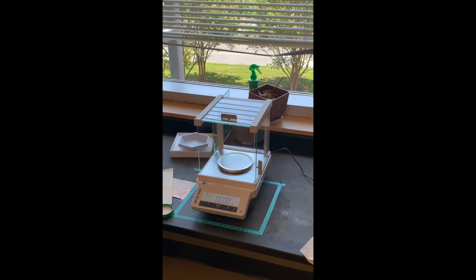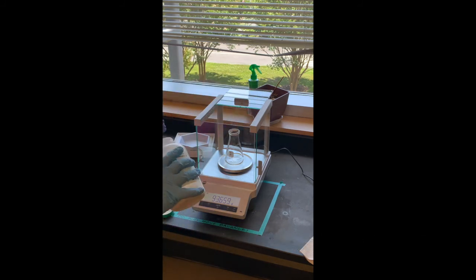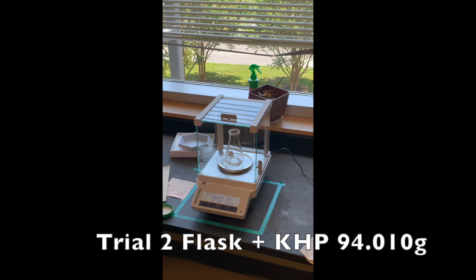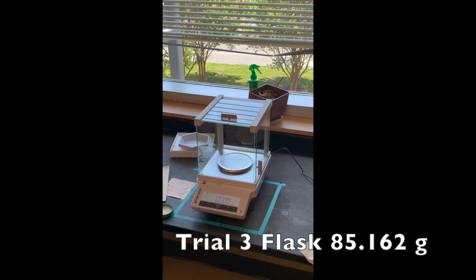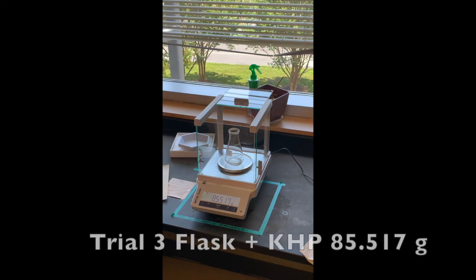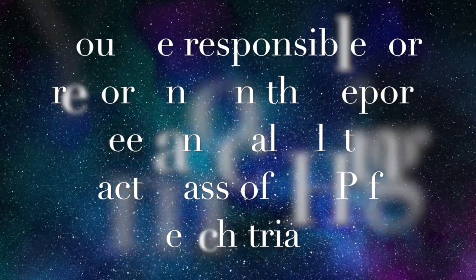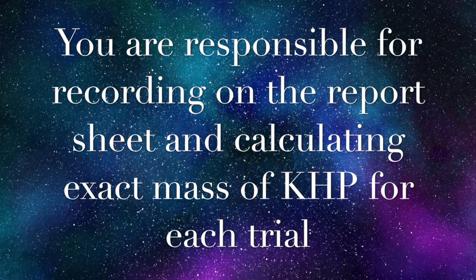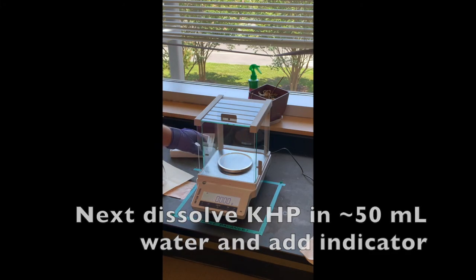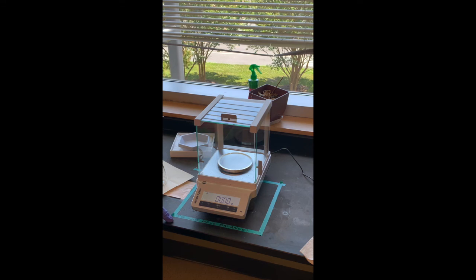The second flask mass is 93.659 grams, and the flask plus KHP for Trial 2 is 94.010 grams. For our third flask, the flask mass is 85.162 grams, and the flask plus KHP for Trial 3 is 85.517 grams. You can calculate the mass of KHP used for each trial by subtracting the flask mass from the flask-plus-KHP mass. To get these samples ready to titrate, we want to dissolve the KHP in water, then add about two drops of phenolphthalein indicator, and then we'll be ready to titrate.